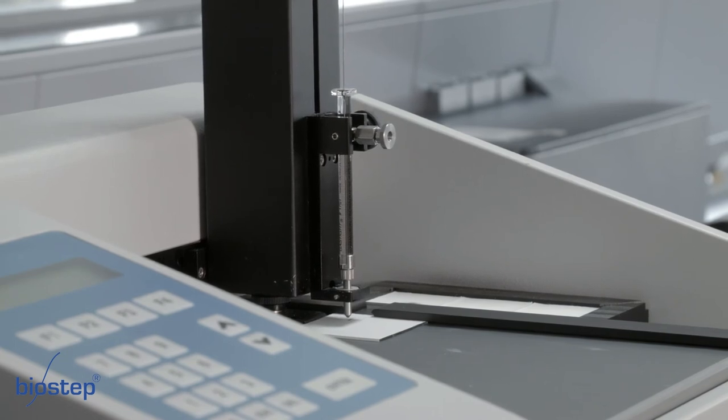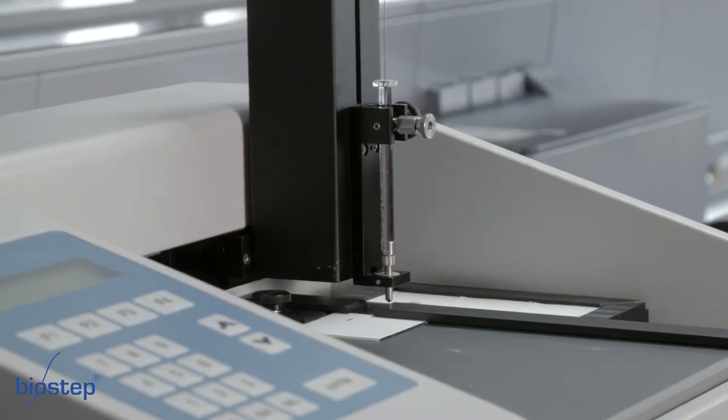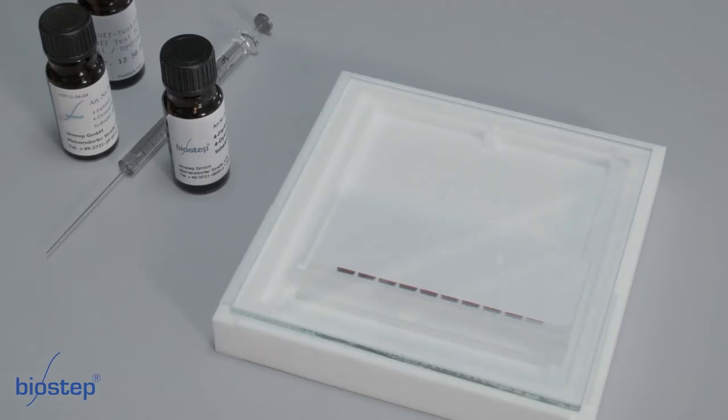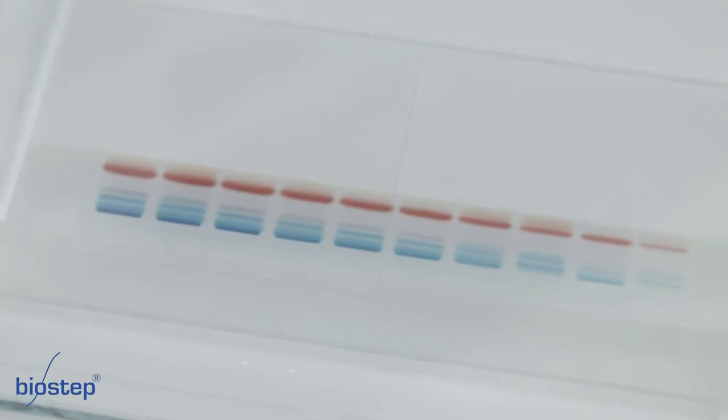After all samples are applied, separation can take place. The separation is carried out in an H-separating chamber.